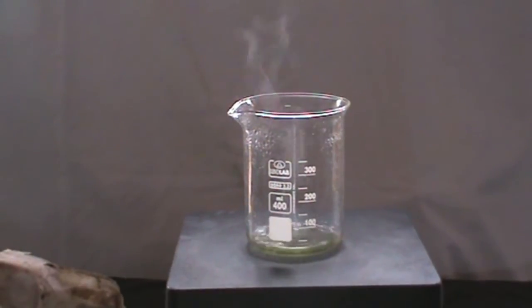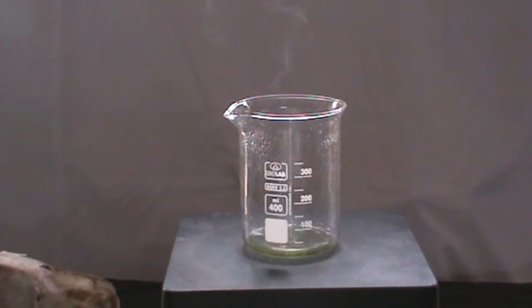After a while, we can see that most of the water has almost evaporated off.